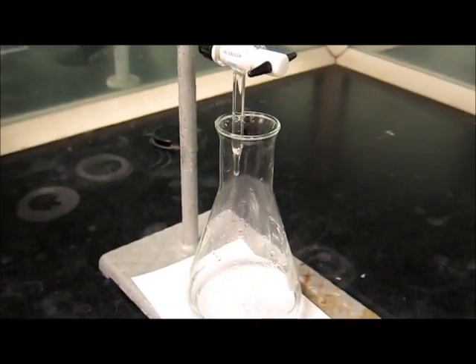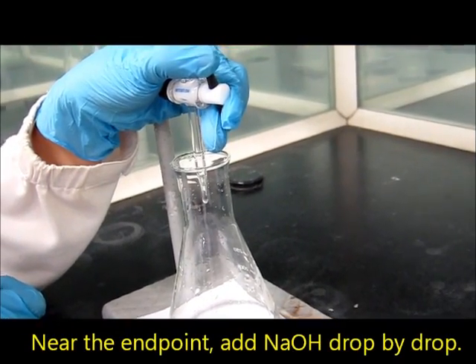As you are reaching the endpoint, add aqueous sodium hydroxide drop by drop.